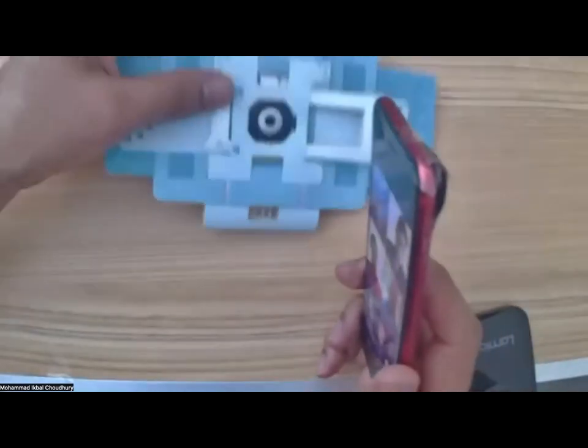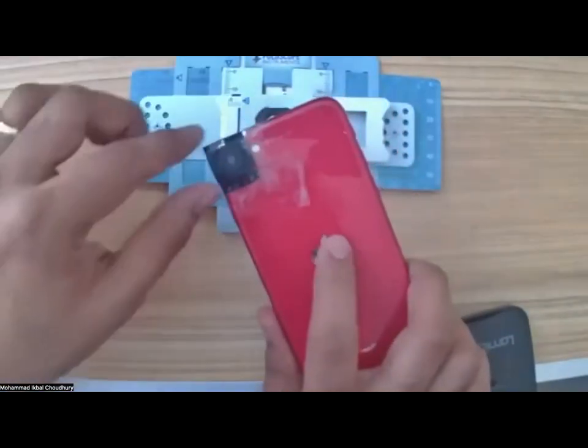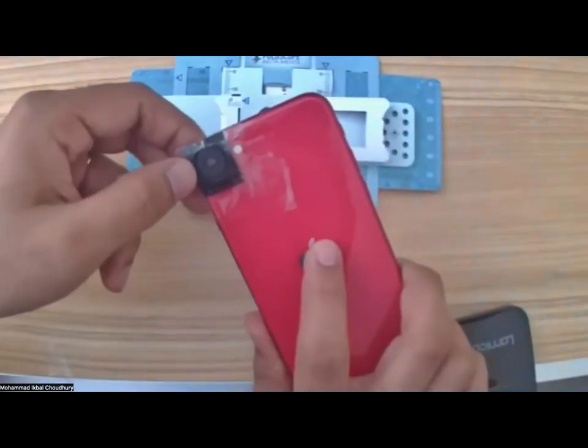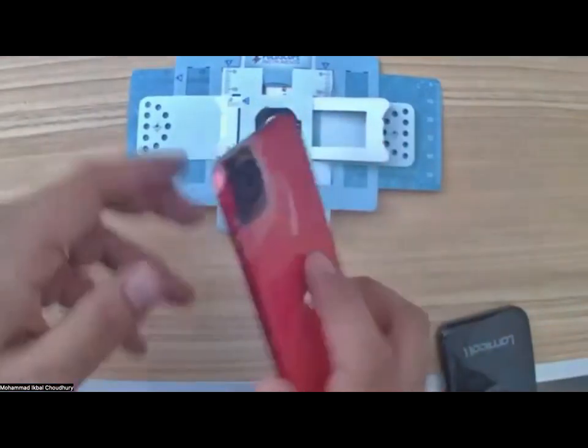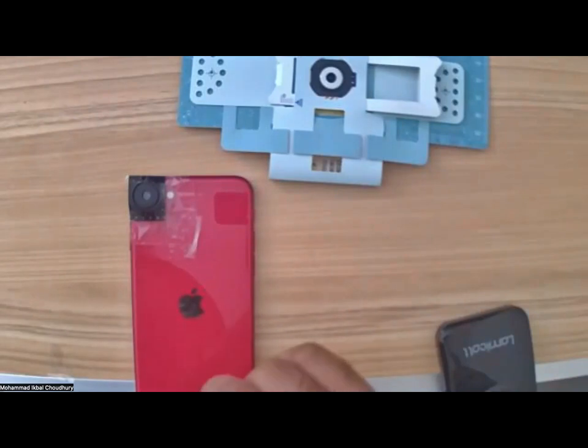So meanwhile, since I've been moving this around, I probably have lost my sample, so I'll realign that. So that's our first step. We did connect the magnetic strip or adapter to the cell phone, okay? And let's leave it there.